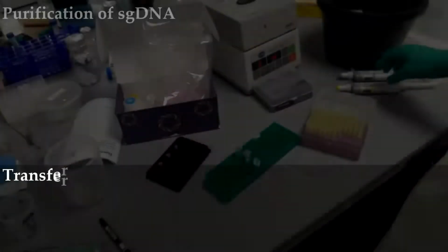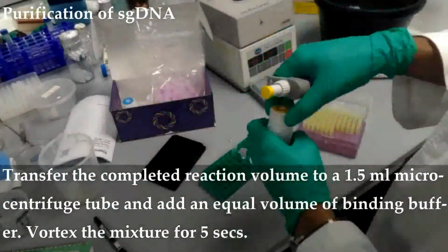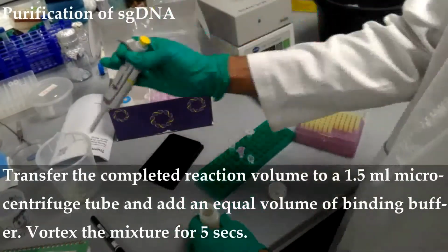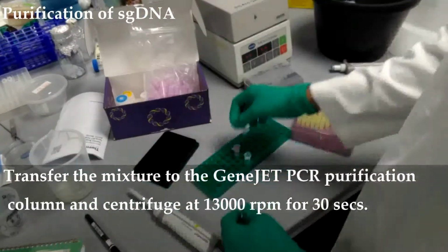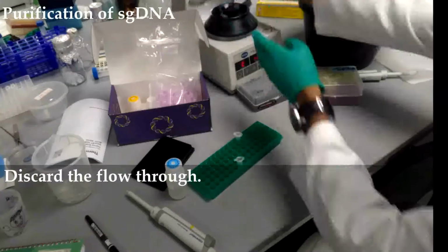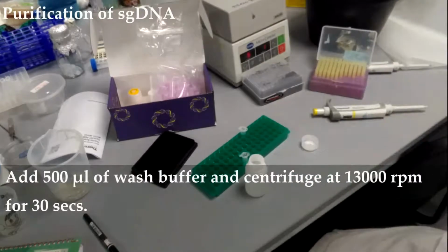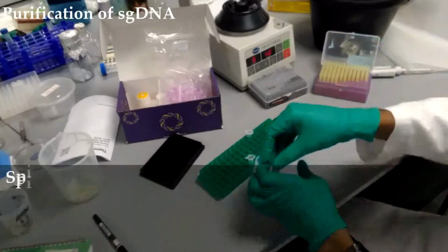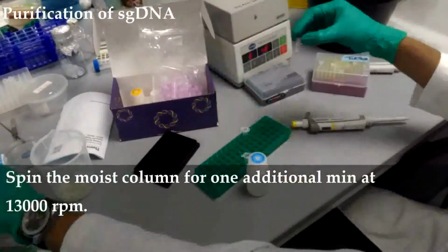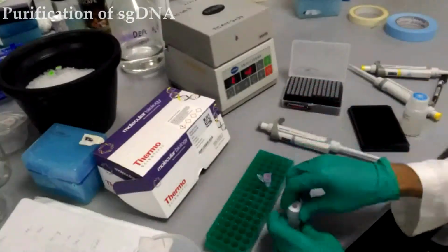Purification of sgDNA. To purify the PCR reaction, transfer the completed reaction volume to a 1.5 ml microcentrifuge tube and add an equal volume of binding buffer. Vortex the mixture for 5 seconds. Transfer the mixture to a purification column and centrifuge at 13,000 rpm for 30 seconds. Add 500 microliter of wash buffer and centrifuge at 13,000 rpm for 30 seconds. Discard the flow through and repeat the step one more time. Spin the empty column for 1 additional minute at 13,000 rpm. Transfer the column to a new tube, add 20 microliter of elution buffer and centrifuge at 13,000 rpm for 1 minute.